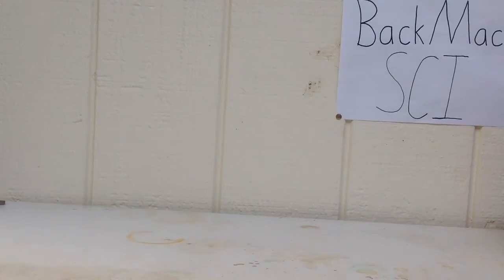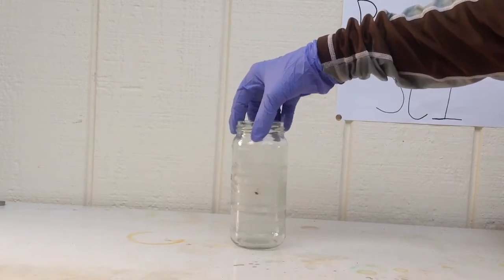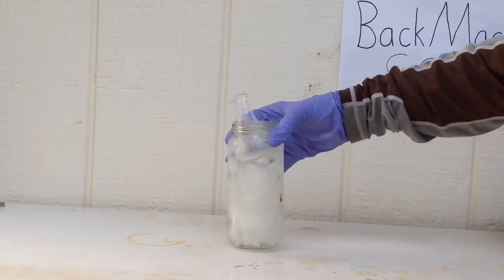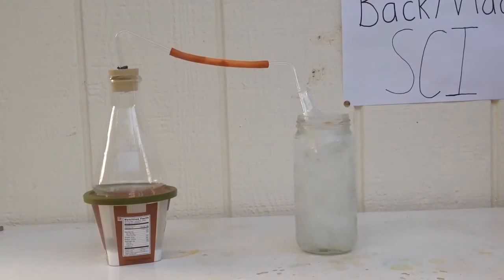I'm going to go get my gloves on. First start off by filling a jar that will fit your mini flask with ice. Fill it with ice and a little water. A setup like this is what you're looking for.